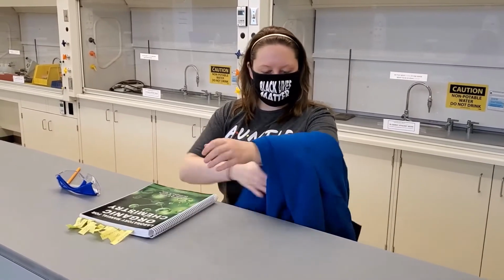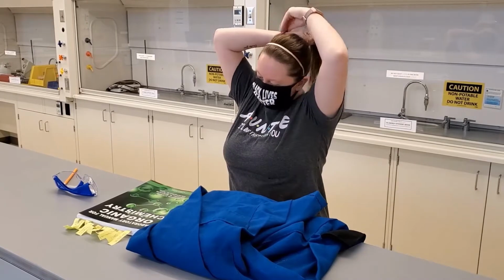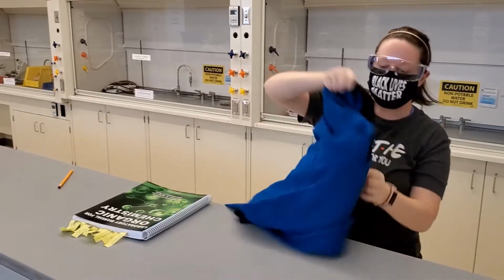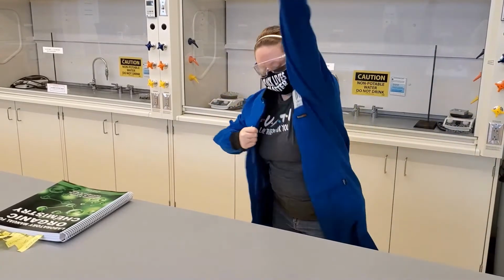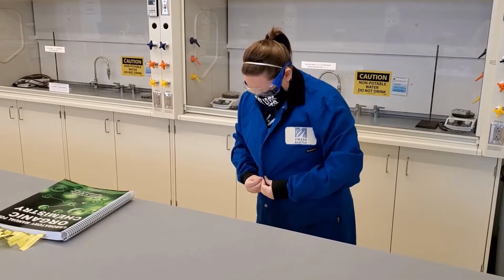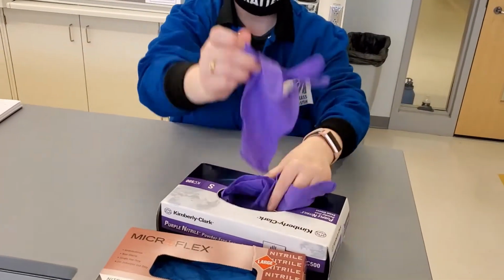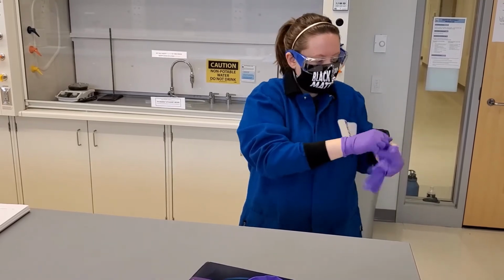On her second try, the student is now ready for lab. She ties up her hair with hair ties so that it is out of her face. She puts on her lab safety goggles, and she puts on her lab coat, which is fire retardant and is graded for lab chemicals. The student also double checks her list of chemicals for today's lab and puts on her lab gloves.